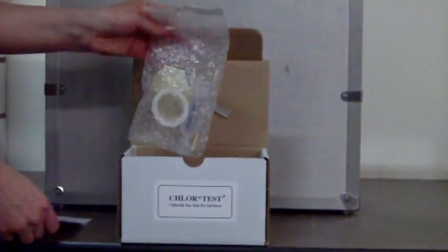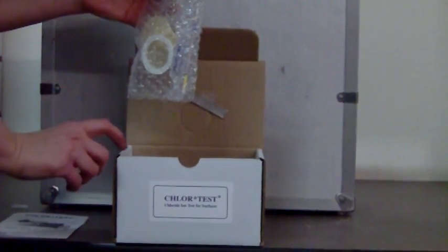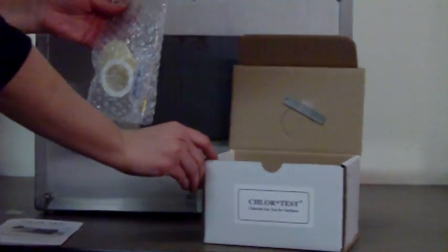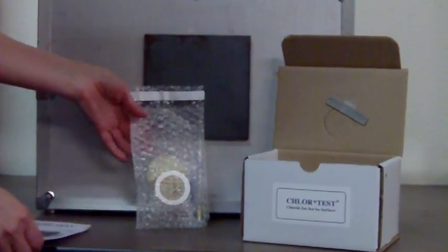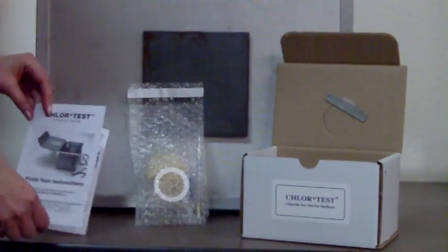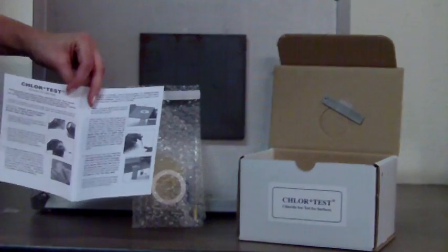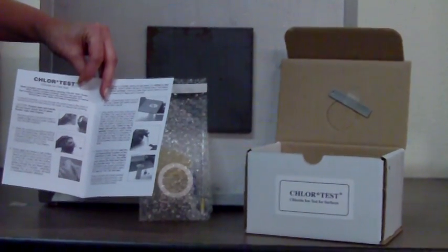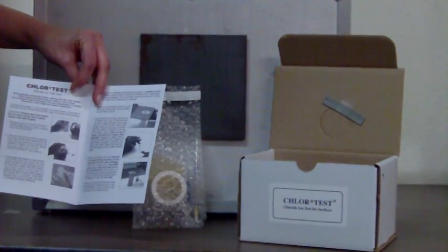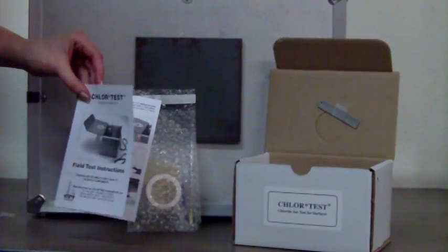There are five little bubble bags in there that contain everything needed for an individual test. Five of those bubble bags and then there's the directions. The directions do cover each step of the procedure precisely. It is important to read those directions, so please do.